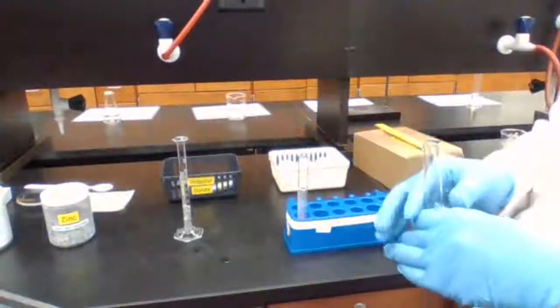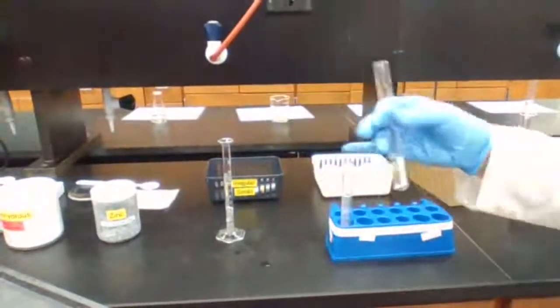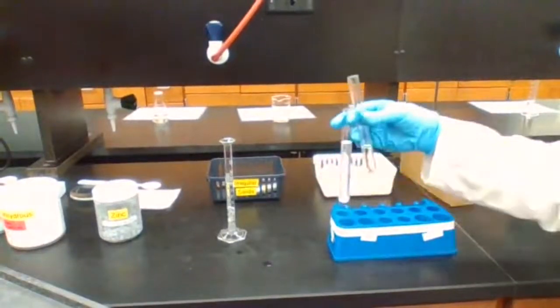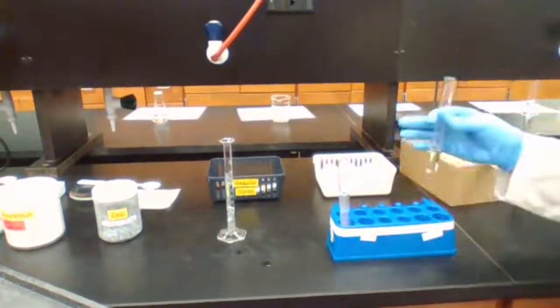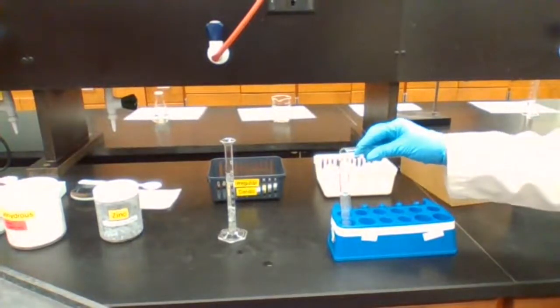So maybe we can finish this part of the experiment. The hydrochloric acid, and then I have sodium carbonate in this test tube. I'm not holding it because it's just like adding baking soda and vinegar. It's going to produce lots of carbon dioxide. It's showing a chemical reaction.